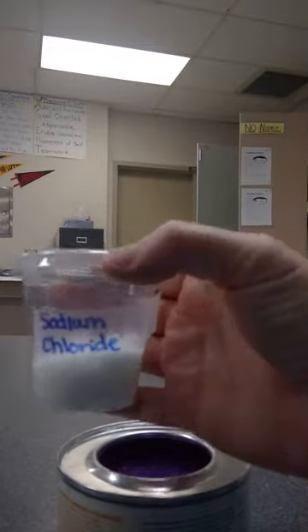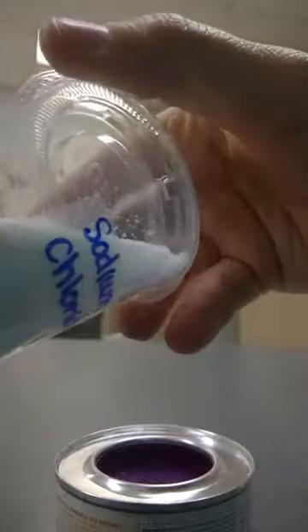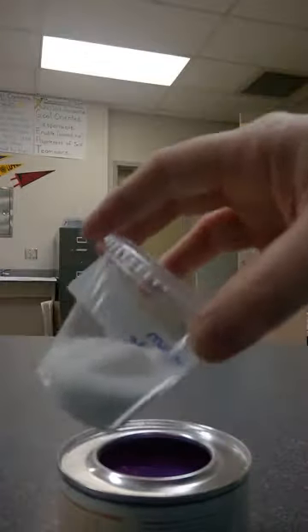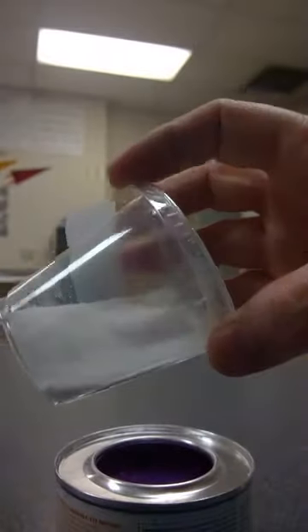Next we have sodium chloride, which looks a lot like the ammonium chloride. It's white in color, has very small granules, it's a solid, and some of it is also clumping together. It too looks a lot like table salt.